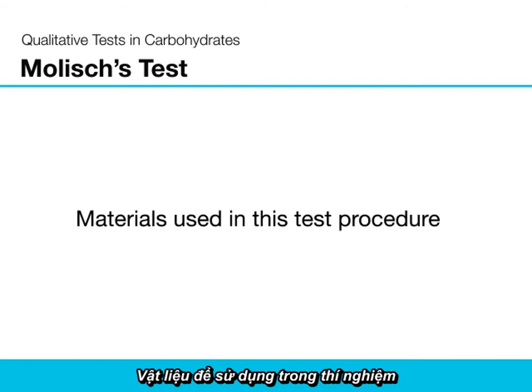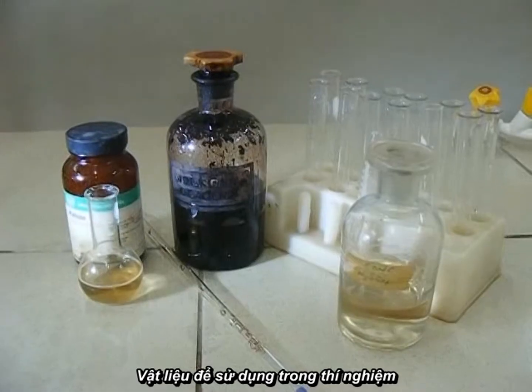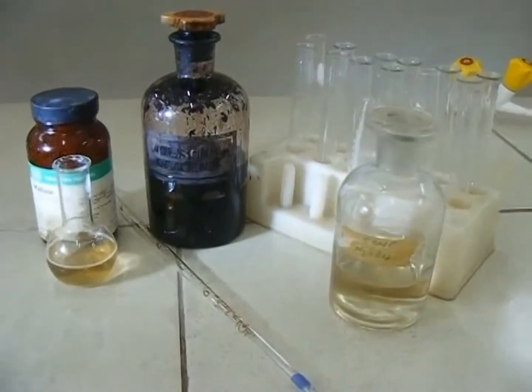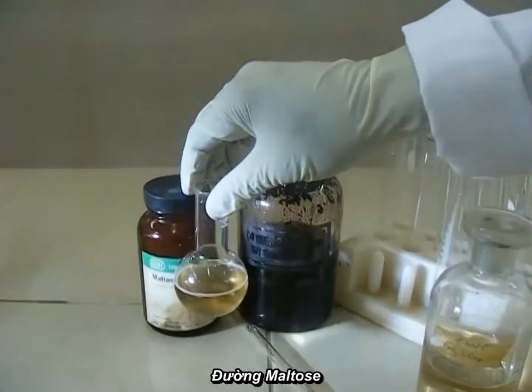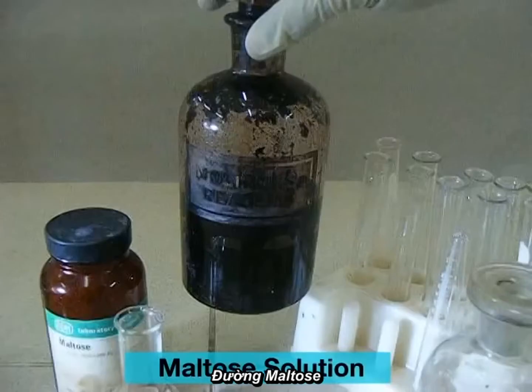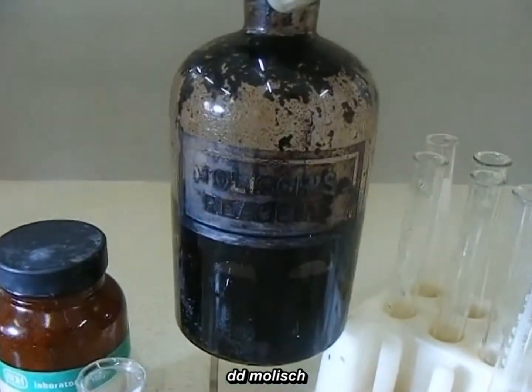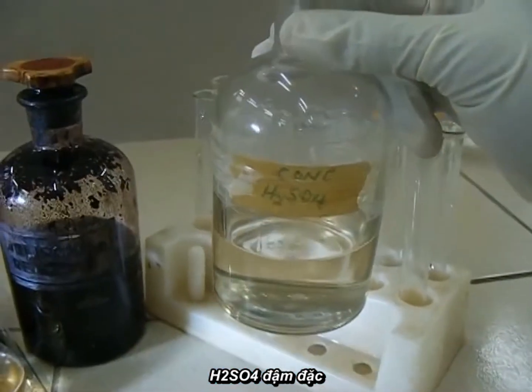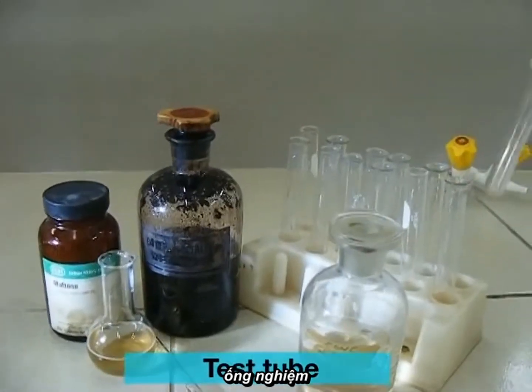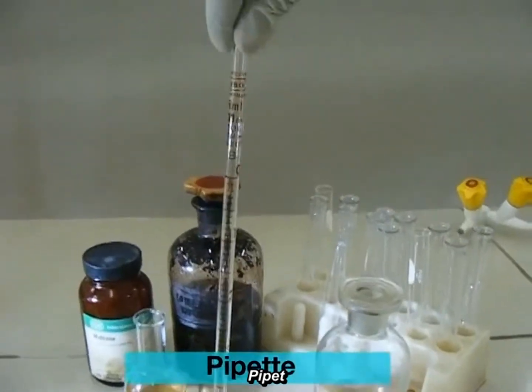Materials used in this test procedure: Molisch reagent, concentrated sulfuric acid, test tubes, a measuring cylinder and a pipette.